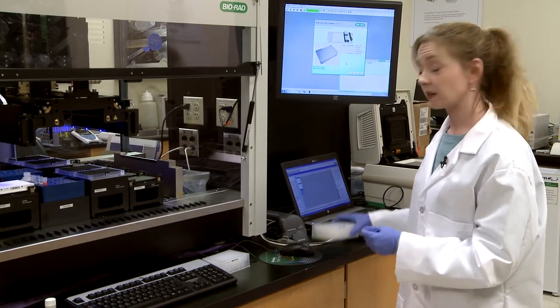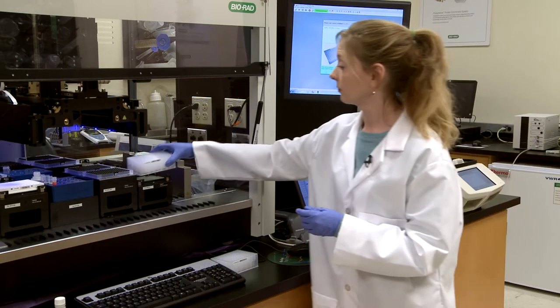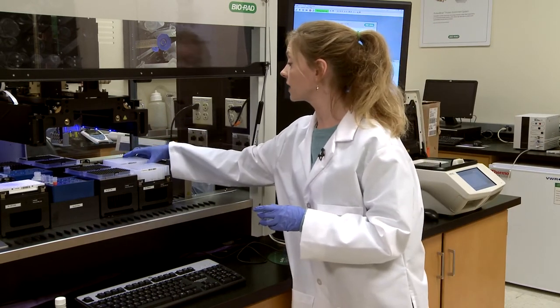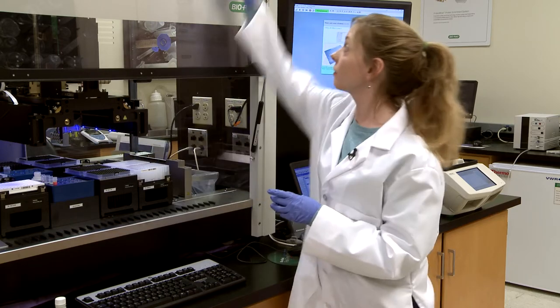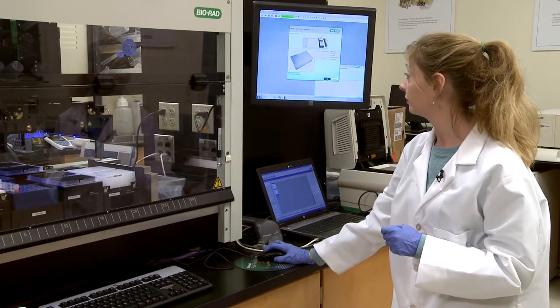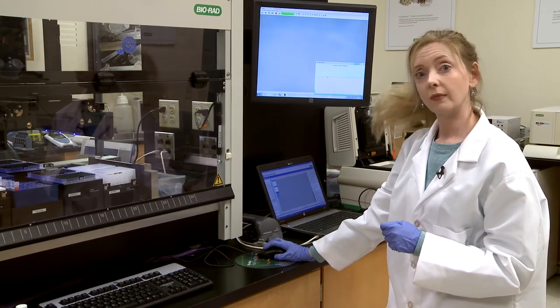The robot tells me that I now need to add my deep well plates, the sample plate and the empty plate. And at this point we close the robot and we hit OK, and it starts.